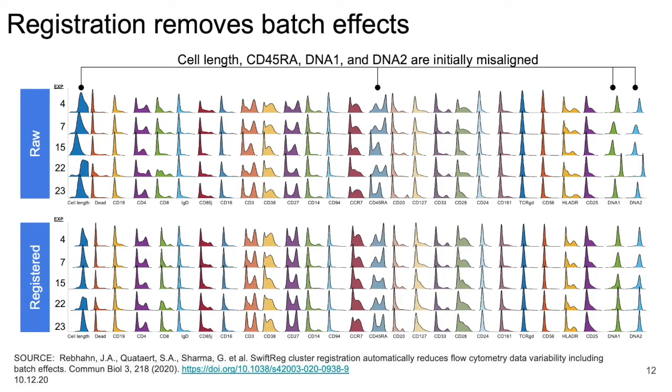So the results that you'd expect, in this case, this is a CyTOF data set, and the upper panel is the raw data and the lower panel is the registered data. And of interest are these for the cell length, CD45RA, DNA1 and DNA2. You can see misalignment in the DNA channels and some misalignment in cell length and CD45RA. And after registration is applied, the four channels are better aligned, and we can apply one consistent analysis now across that entire experiment.